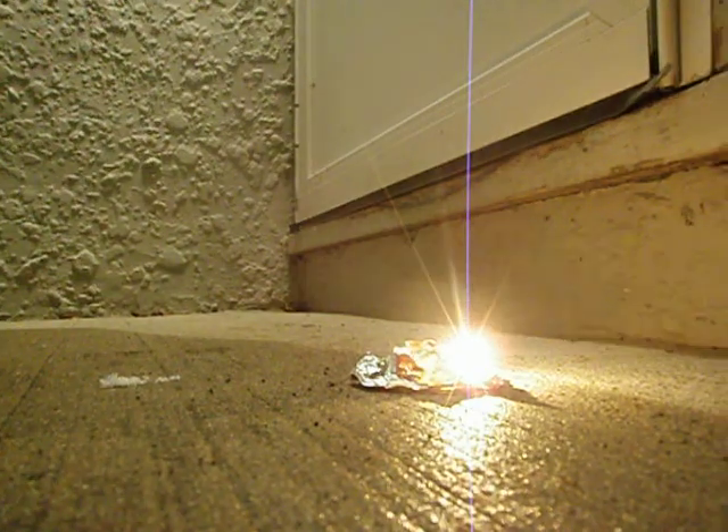Well, as you can see, it burns very high. It's put a hole through the tin foil here and even burnt some of it. And that's the reaction between potassium permanganate and glycerin with some magnesium. Very good task.